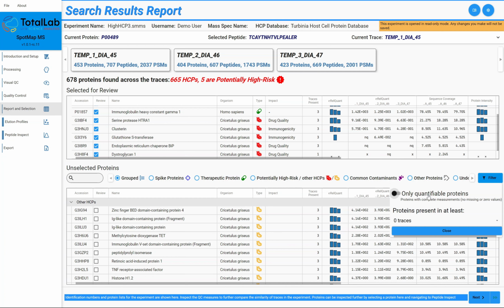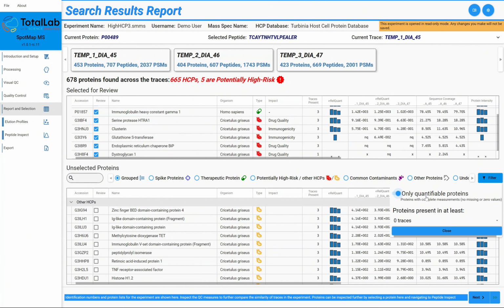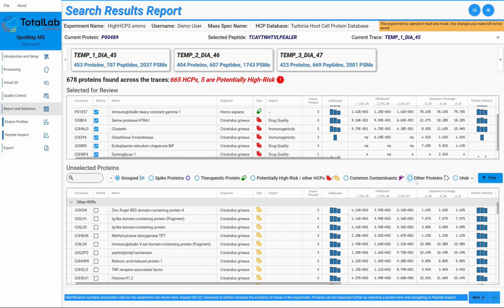Now, again, it's a unique problem. Host cell proteins in LCMS can be present in incredibly small amounts and still pose a risk. So that's why we did quantify them in the beginning, because we wanted to be very upfront with users and say, look, this may potentially be in your sample, even if it's a very rare chance, or even if it's a very small amount, we think there's a chance this host cell protein might be present. And then it would be on the user to determine whether that host cell protein was something that they cared a lot about, because obviously some host cell proteins have no identified risk with them, and some have very high risk to drug product and drug stability. But we can turn that off, so any kind of host cell protein that we're unable to quantify, we can just get rid of if we have no values for it.